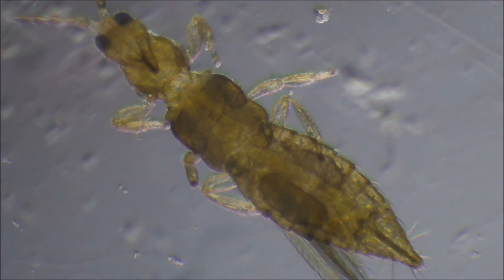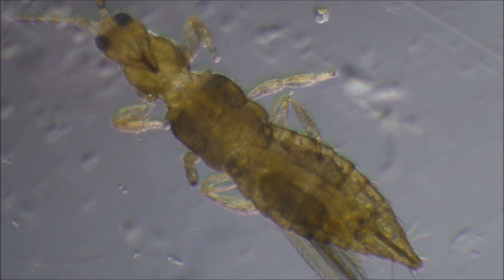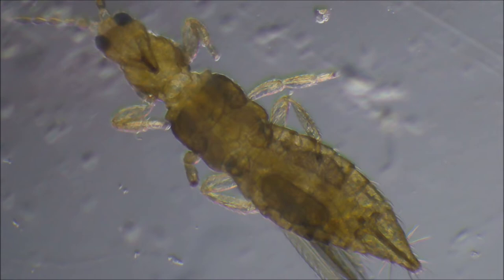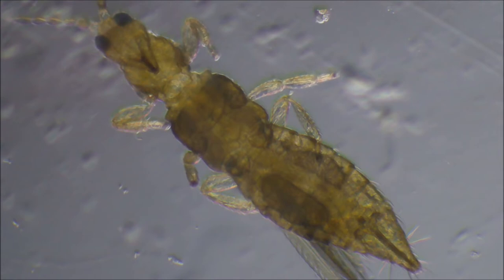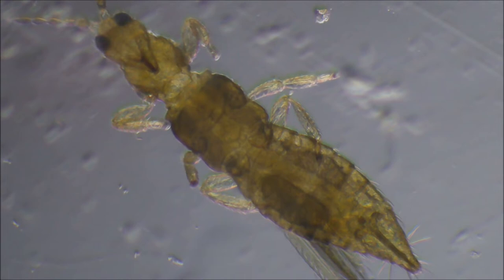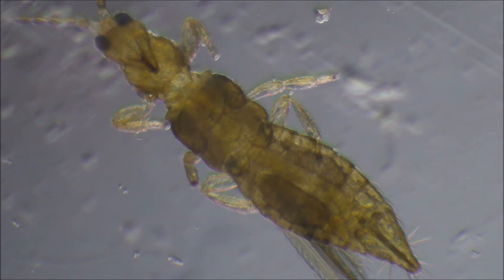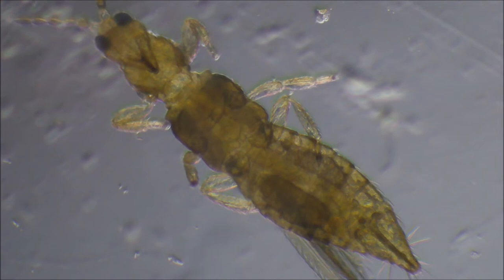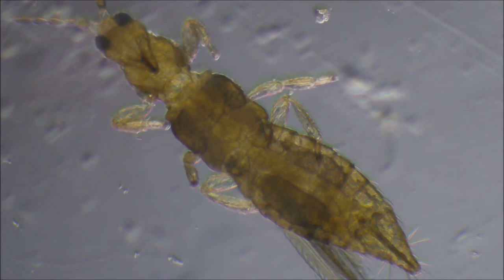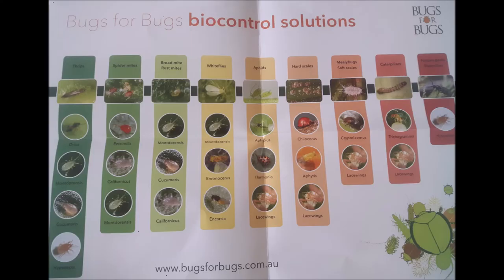The ISO at 91% is wrapping up now — it slowly killed the thrips at approximately 1 minute 40 seconds. This was the one I thought would do the best, but the thrips are so small they can hide against the leaf veins. That's why biologicals are great — they get to spots you can't and eat the eggs too. Here's a chart showing the four main biological types I use.